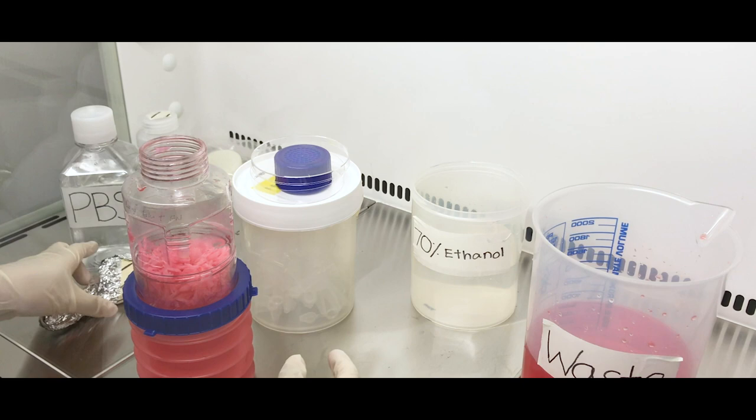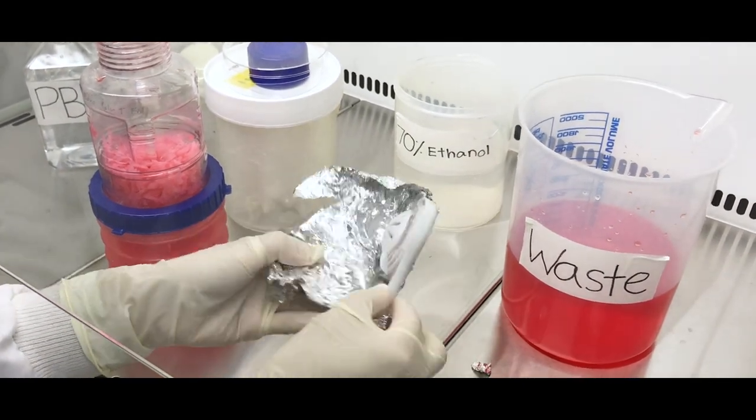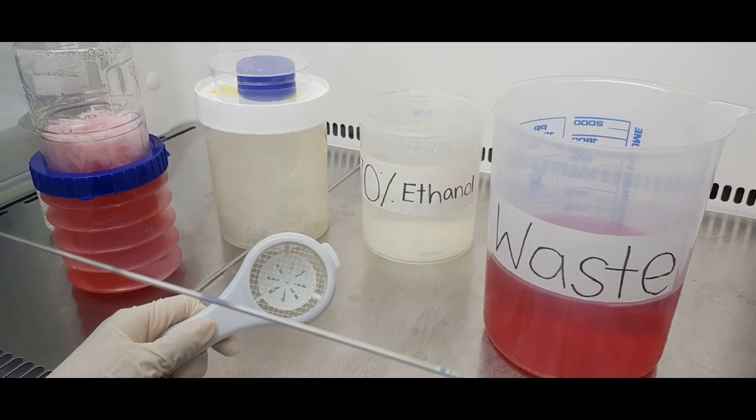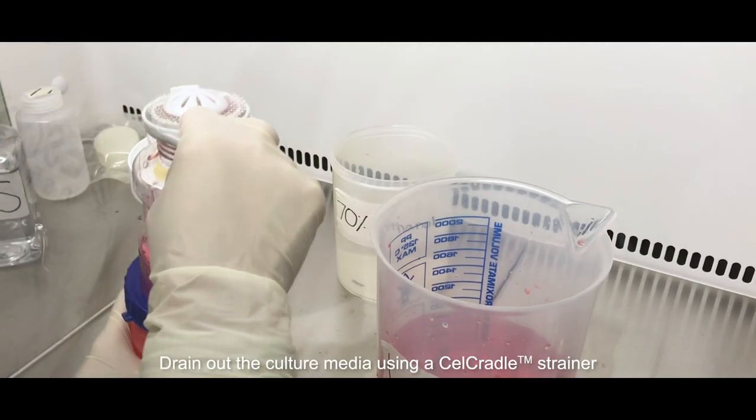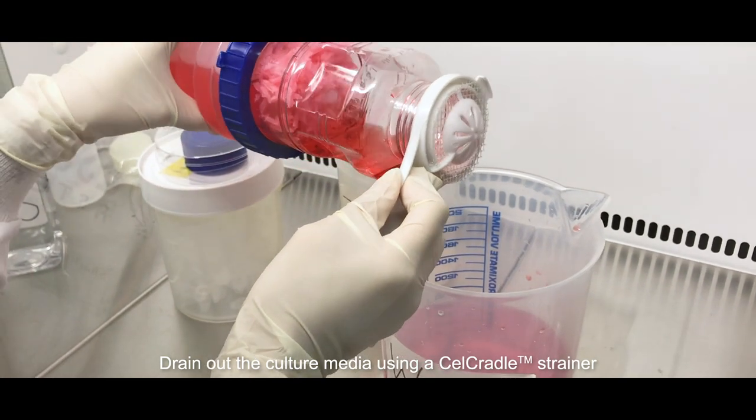The strainer is autoclavable. Keep in mind after the whole process of cell harvesting the strainer should be autoclaved. Using the strainer, drain off the spent culture media into the waste beaker.